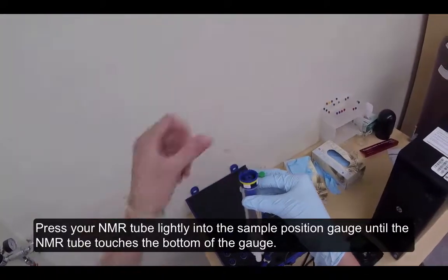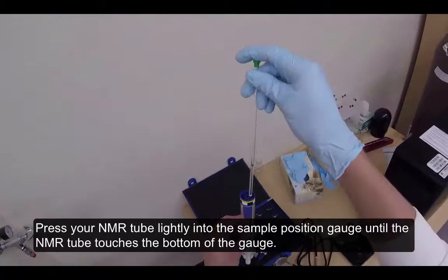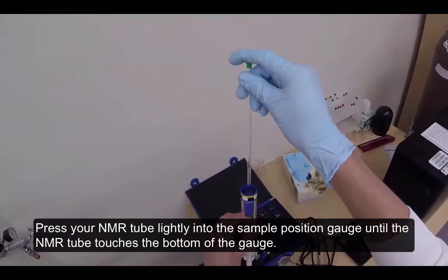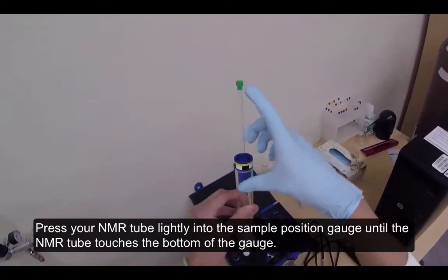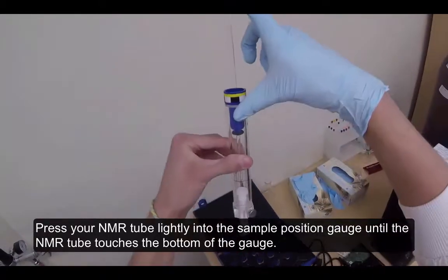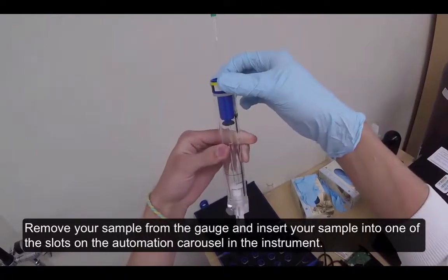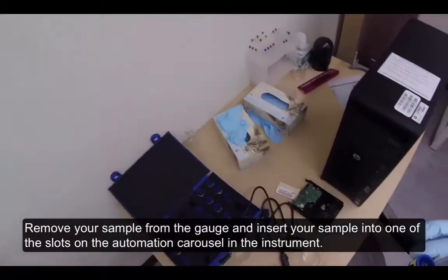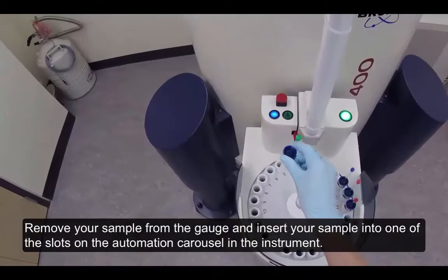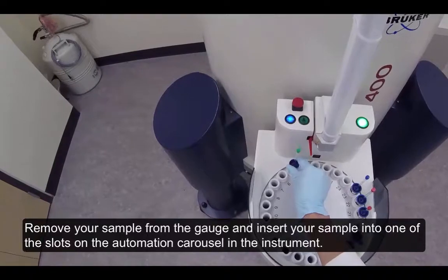Do not touch the NMR spinner below the sticker around the rim with your bare hands. Press your NMR tube lightly into the sample position gauge until the NMR tube touches the bottom of the gauge. Remove your sample from the gauge and insert your sample into one of the slots on the automation carousel in the instrument.